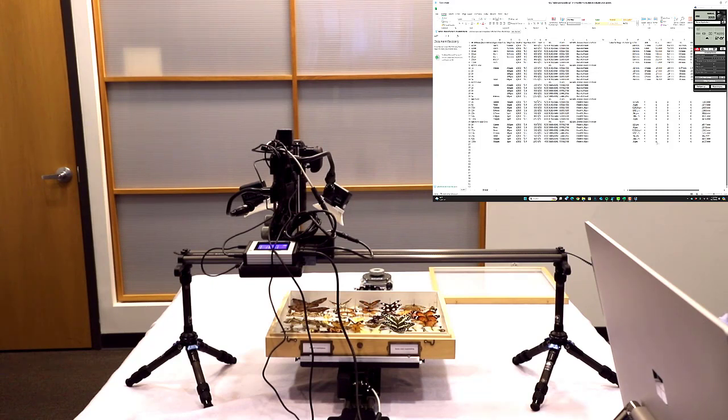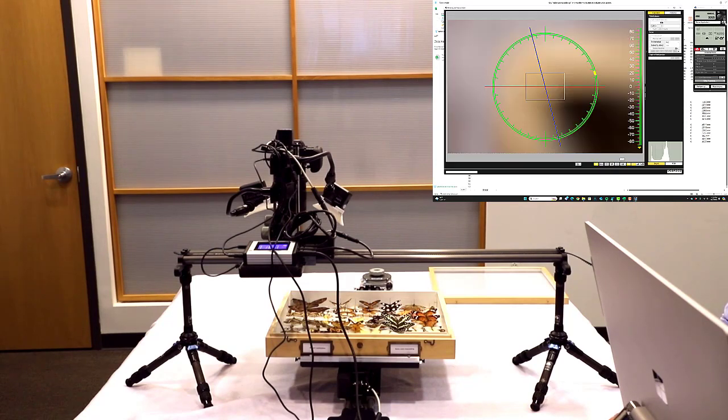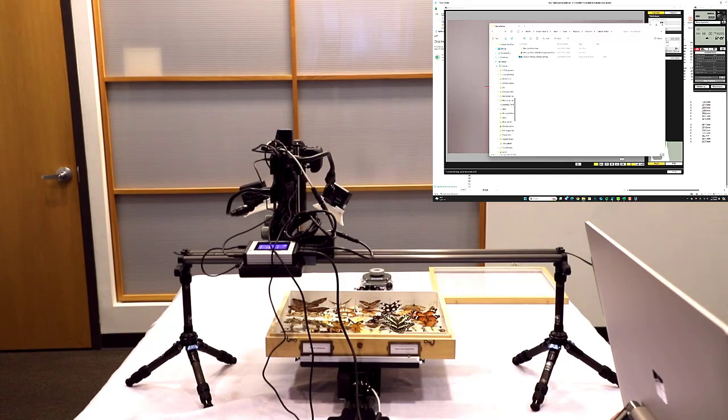Okay, so at the moment, the camera's open and automatic. We're going to open up our live view shoot. I already have a folder that's been created. I created this on an external hard drive, and it's called African Lepidoptera. So that's where my images are going to be stored. If you want, we can navigate to that directory now.